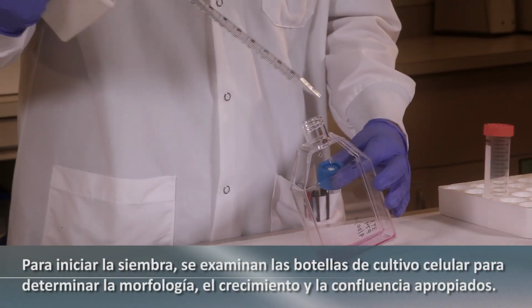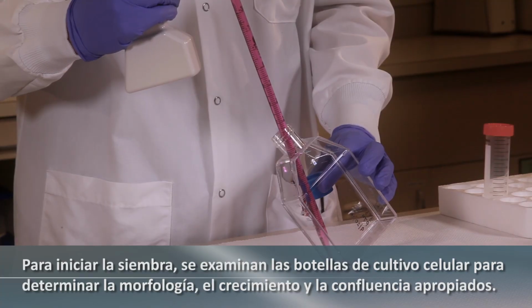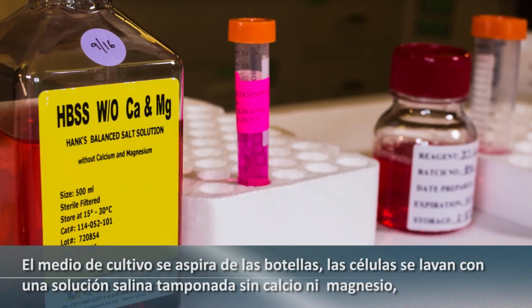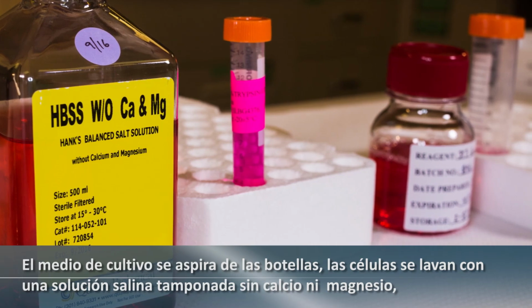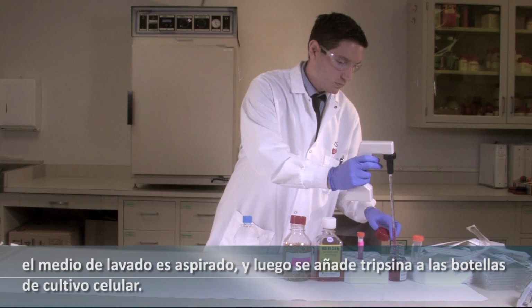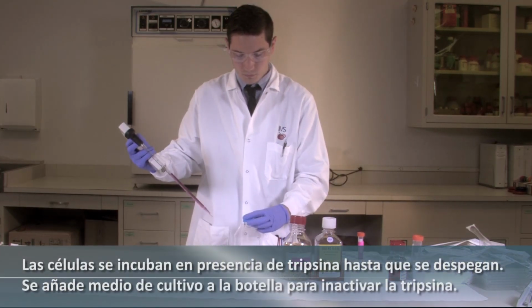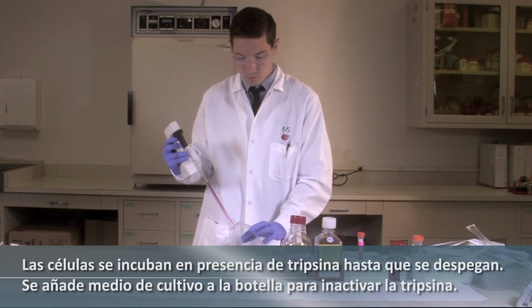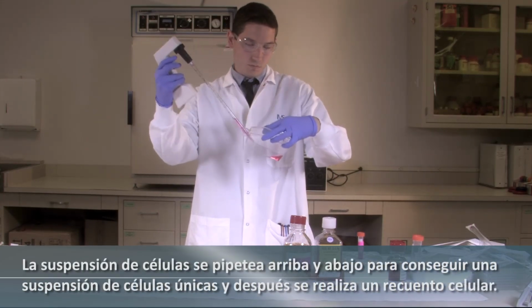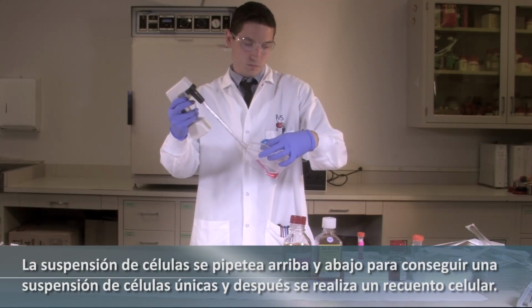To begin seeding, the cell culture flasks are examined for proper morphology, growth, and confluency. The growth medium is aspirated from the flask, the cells are rinsed with a calcium and magnesium-free buffered saline solution, the rinsate is aspirated, and then trypsin is added to the cell culture flasks. Cells are incubated in the presence of trypsin until the cells detach. Growth medium is added to the flask to inactivate the trypsin. The cell suspension is triturated up and down to achieve a single cell suspension, and then the cells are counted.